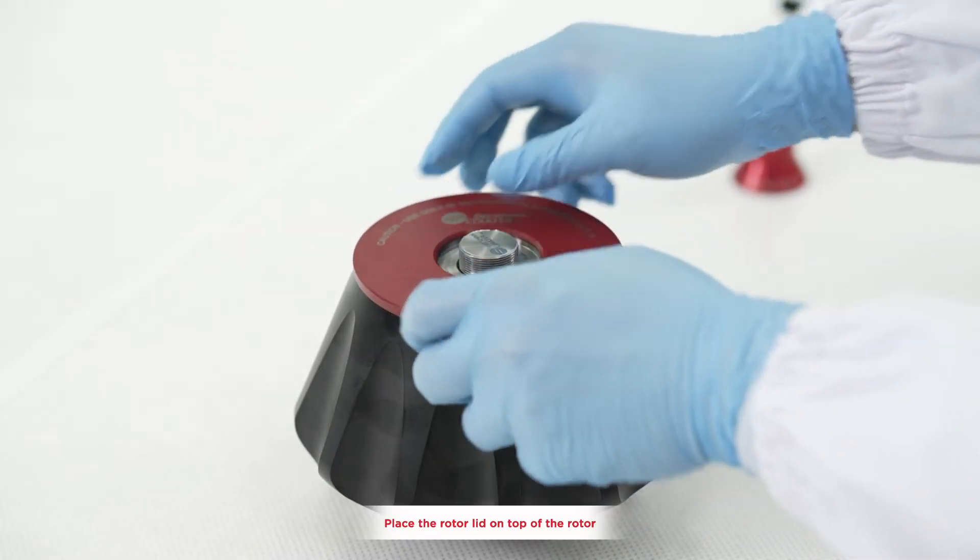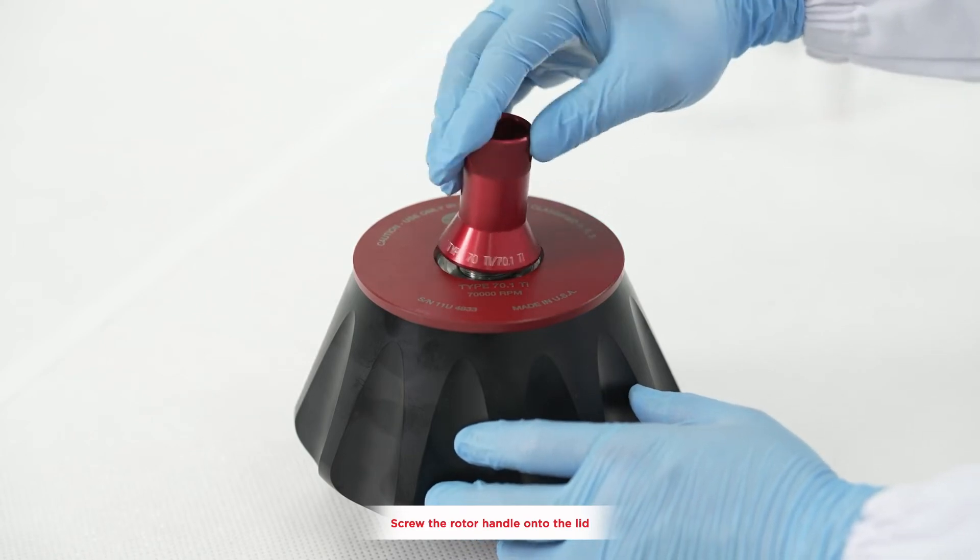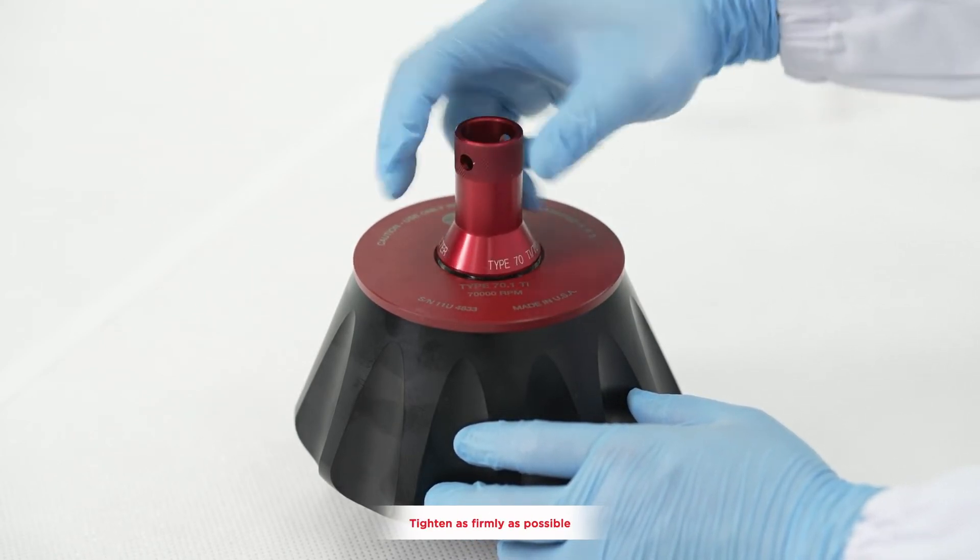Place the rotor lid on top of the rotor and screw the rotor handle onto the lid, tightening as firmly as possible.